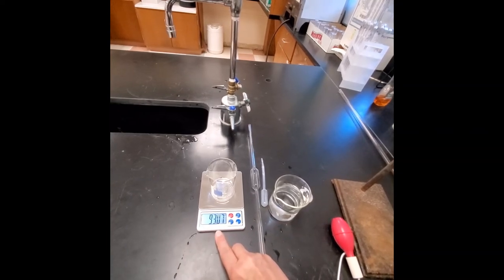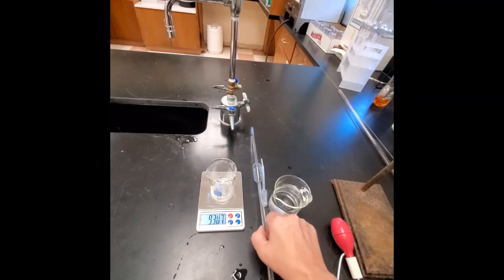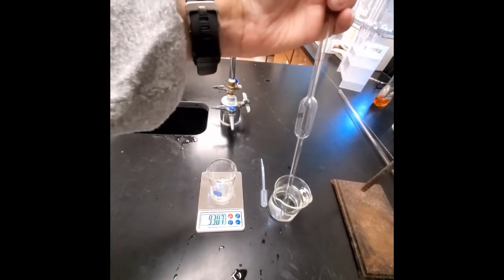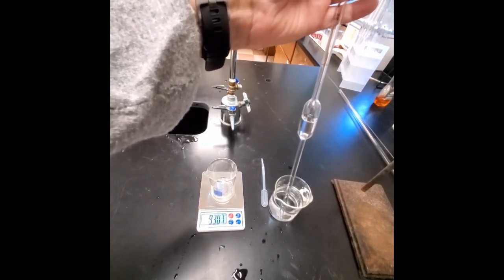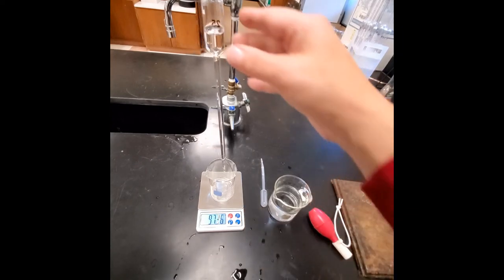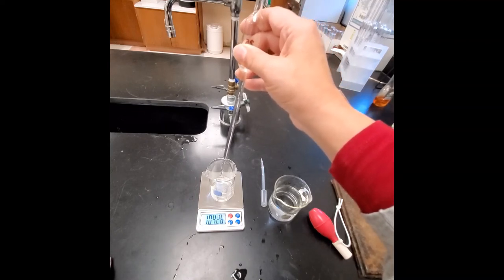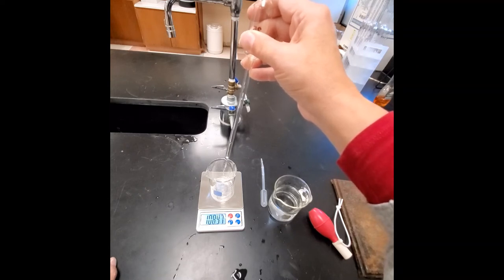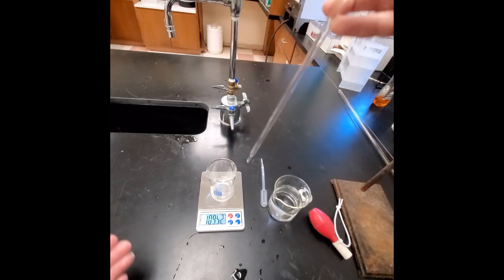Record the mass — this is the final mass of the container plus the sample. You do not need to re-zero; this value becomes the initial mass for the next trial. Fill the pipette again to 25 mL, let it gravity-drain into the beaker, and record the final mass. The final mass from trial one is the initial mass for trial two. Repeat for a third trial. Be careful — if liquid gets on the balance, wipe it off.